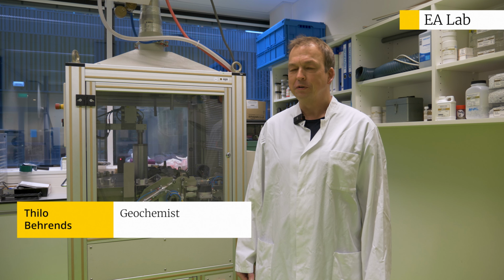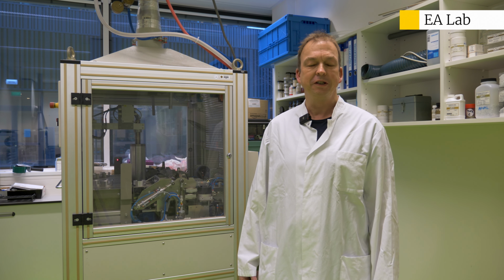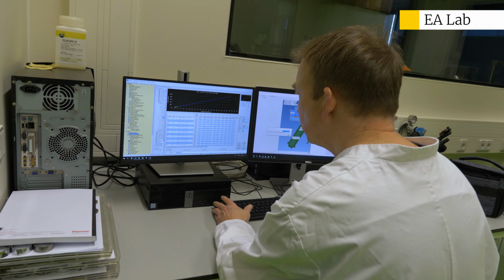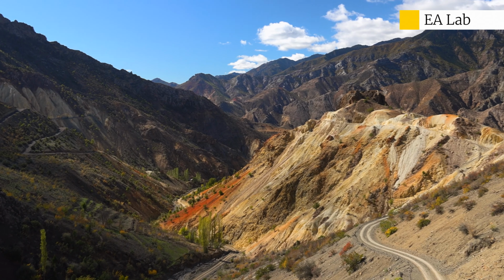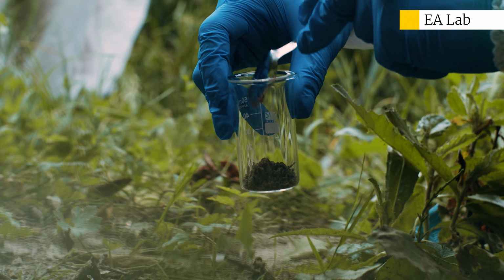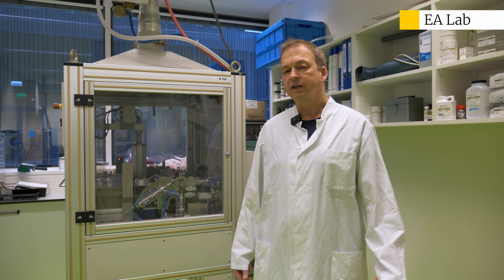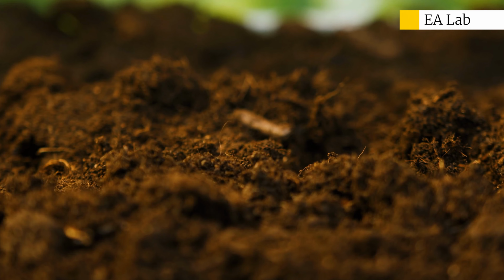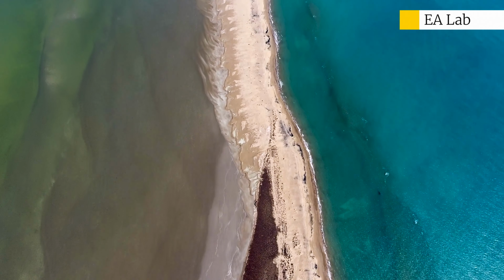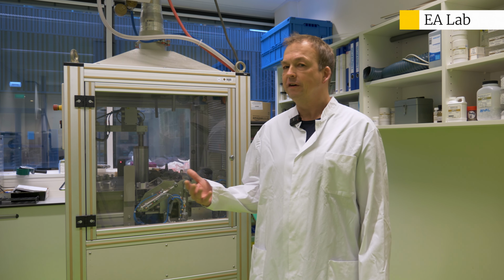Measuring the elemental composition of solid materials is of great importance for many types of research in earth sciences. For example, determining the concentrations of metals and nutrients is important for mineral exploration, or to determine whether the concentration of a metal is above toxic levels in the soil or in the context of assessing the fertility of soils. The elemental composition of rocks or sediments can also provide information about their origin or their formation.